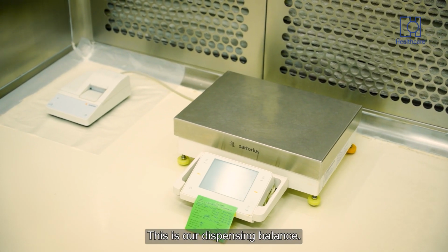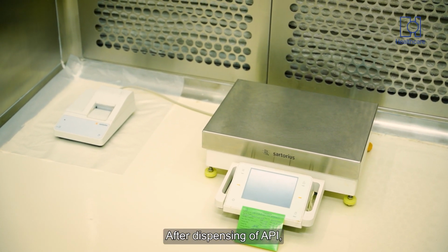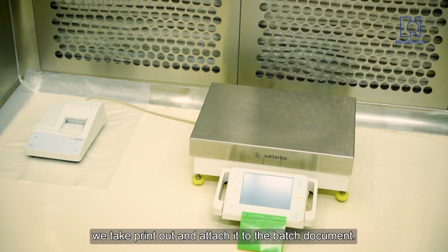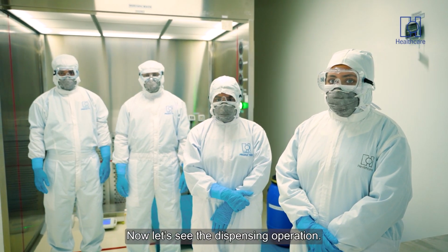This is our dispensing balance. This balance is connected with the printer. After dispensing of API, we take a printout and attach it to the batch document. Now, let's see the dispensing operation.